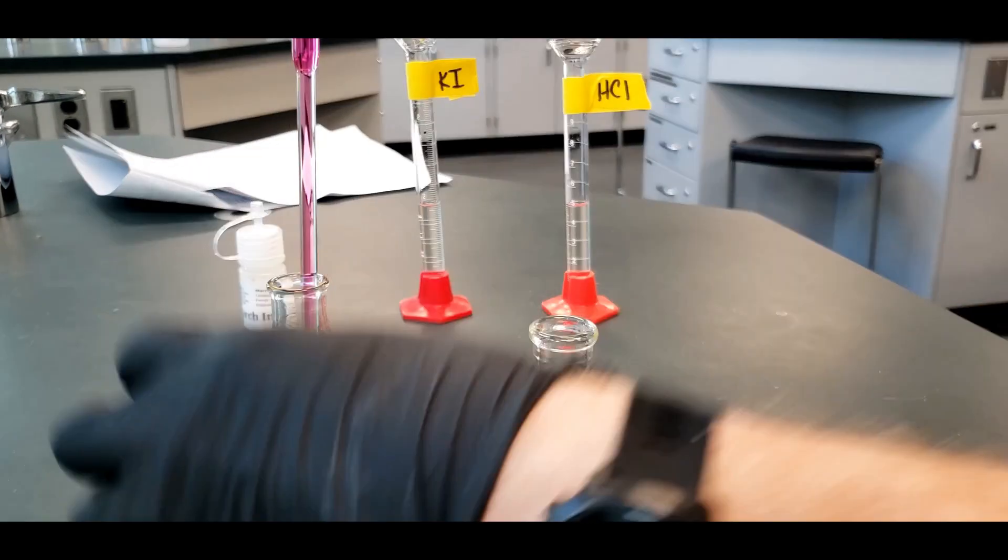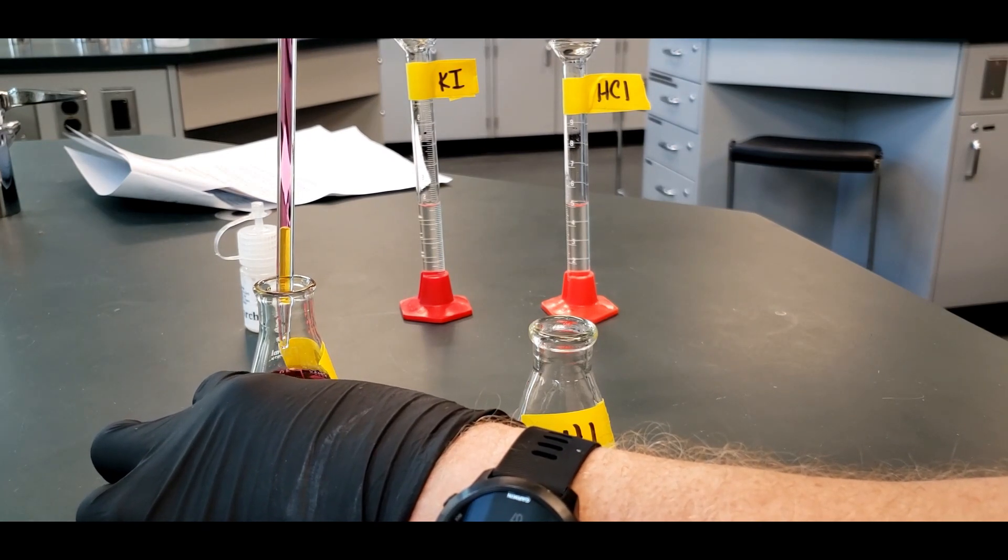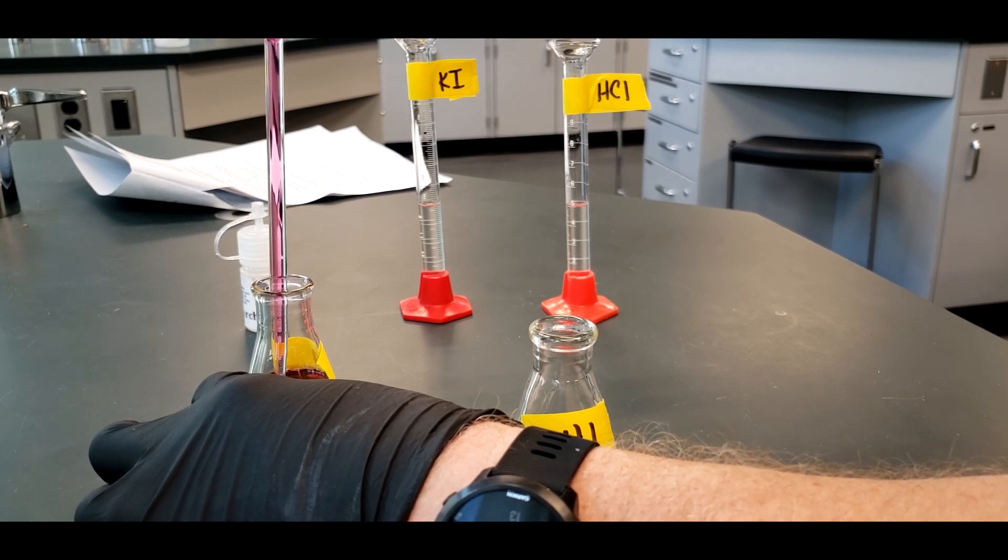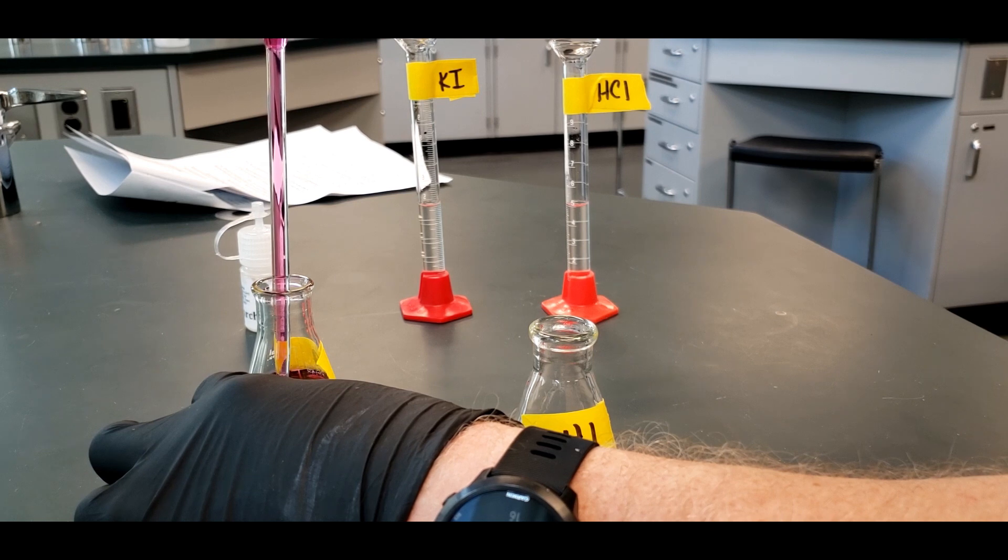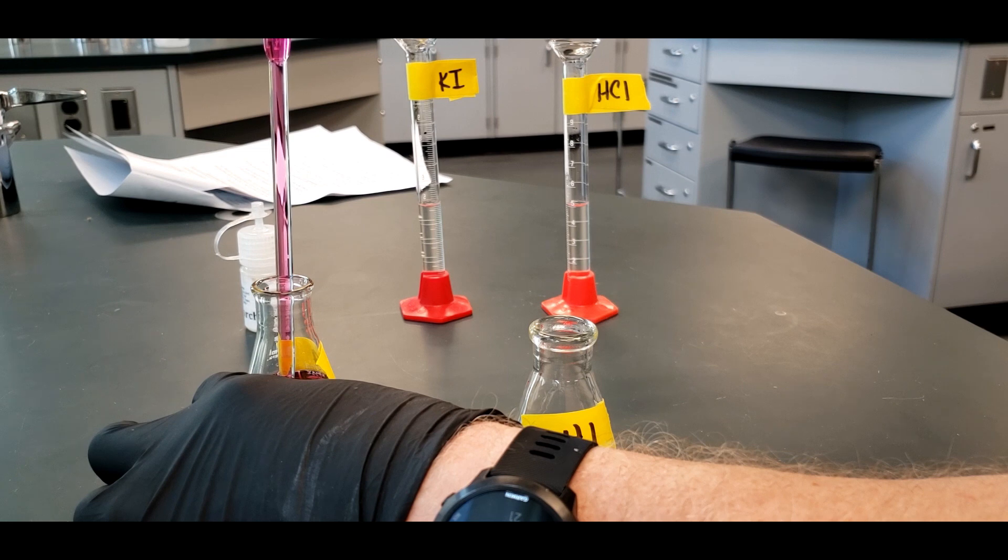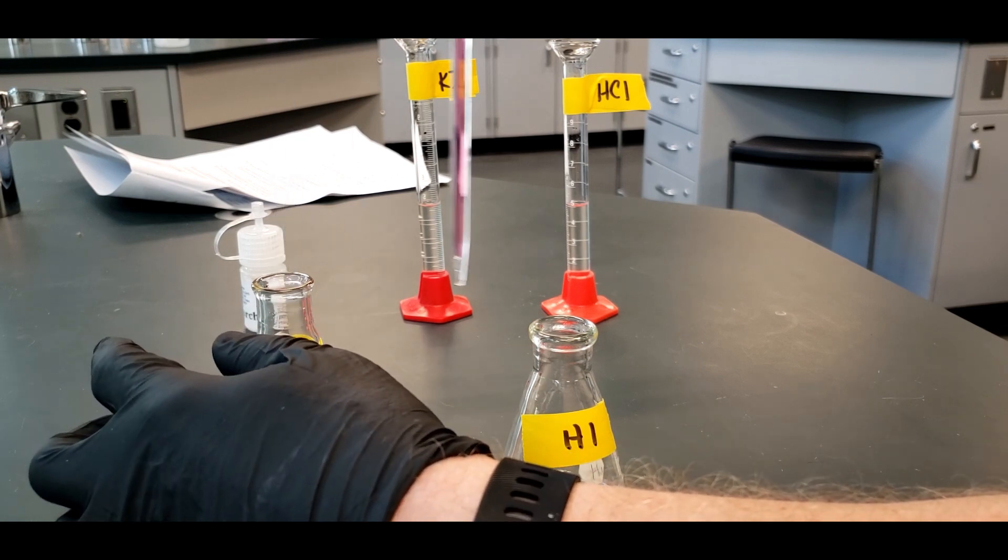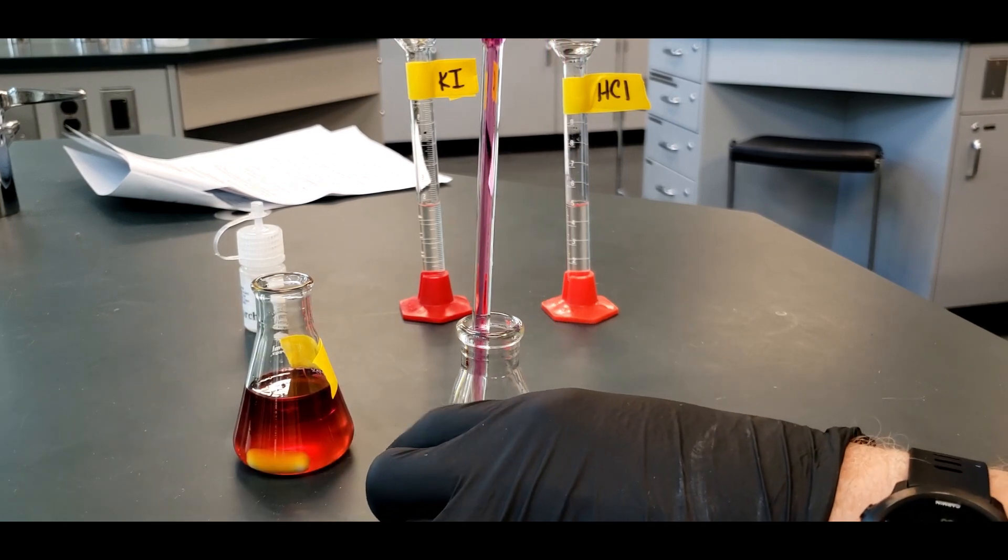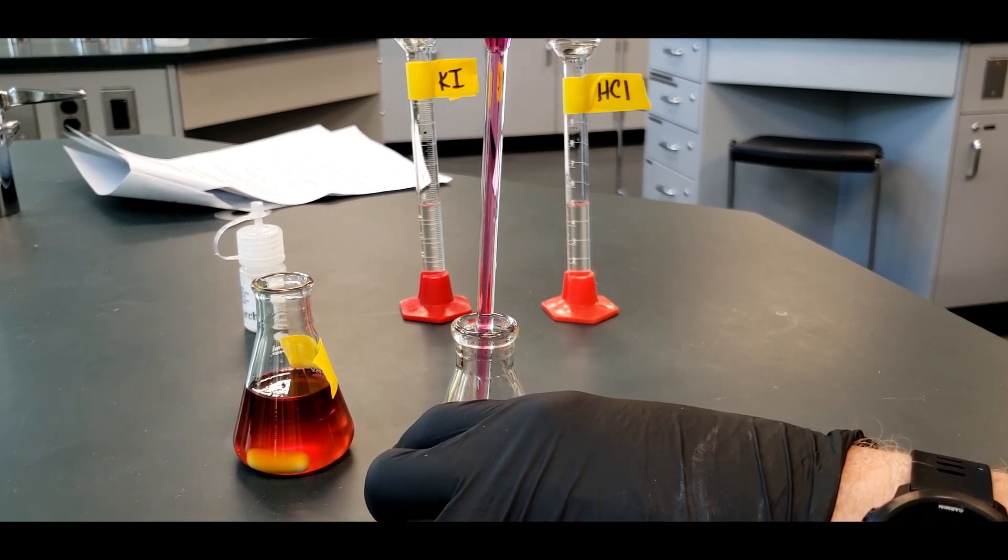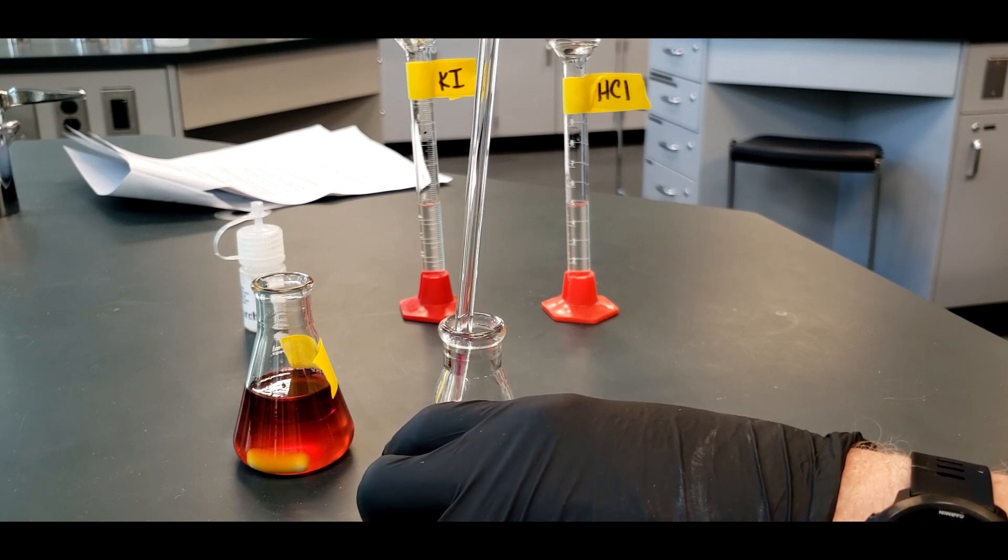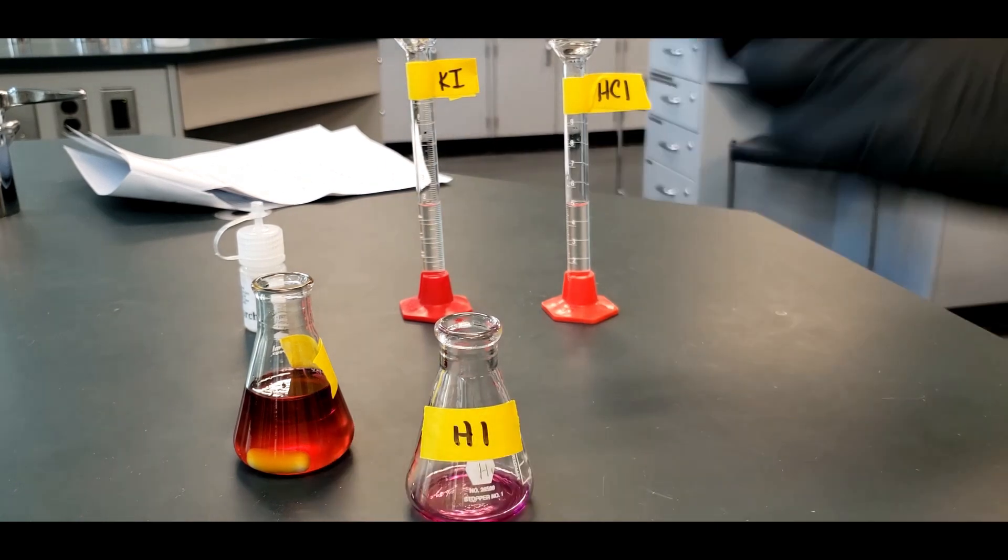If that's the case, if you see even a drop of that, you'll have to put the sample back in and try again. And I actually did, you can see that. So what you do is just put that back in. So I'm right there. I made a little mistake. So I don't think I did it this time. You can see. And then I'm going to just transfer over here. This three mL volumetric pipette. It's really small, really hard to deal with here. But I got it.